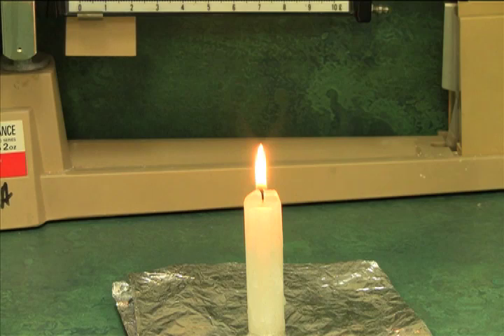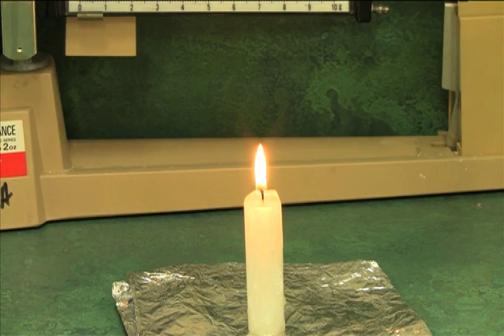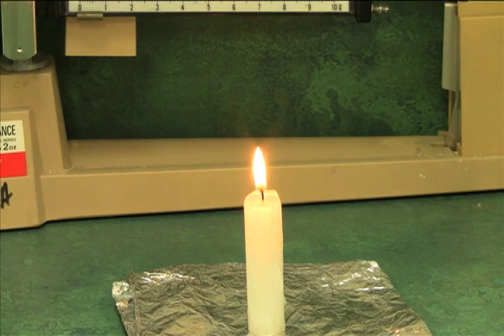On the back of the lab sheet, it says on step six, when doing number five, use the second hand of a watch to time just how long your candle stays lit. And to try this twice. So I'm going to use a small jar first. Here we go.